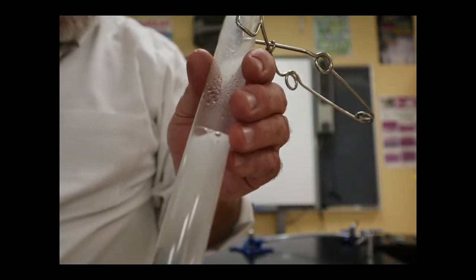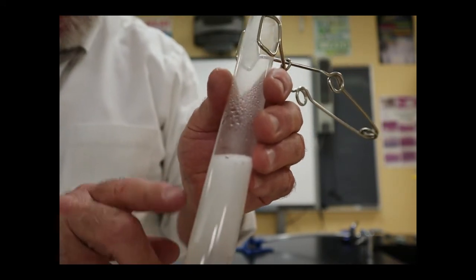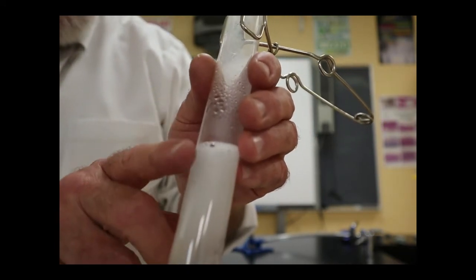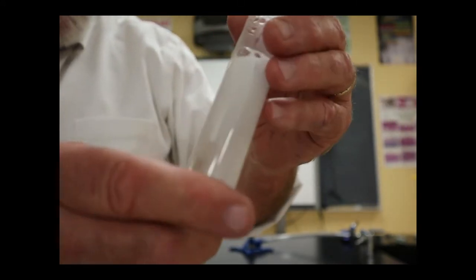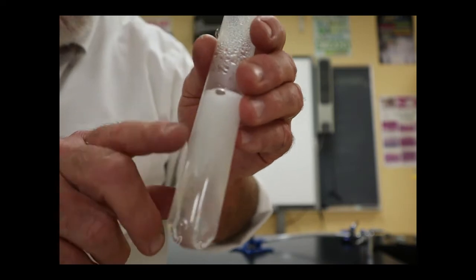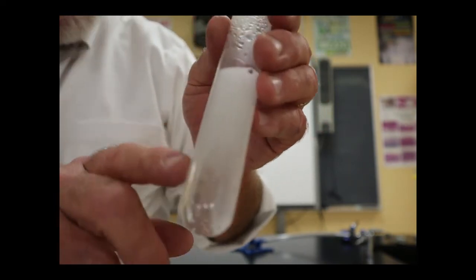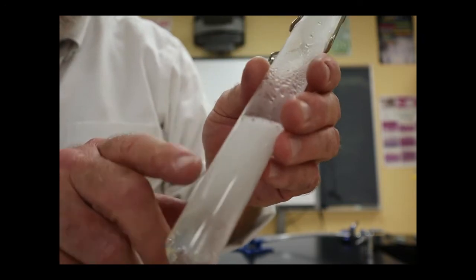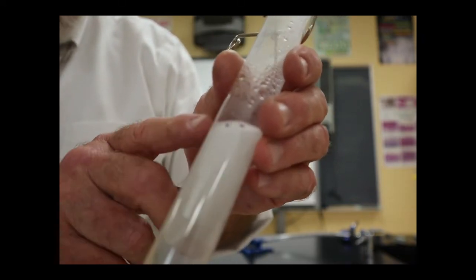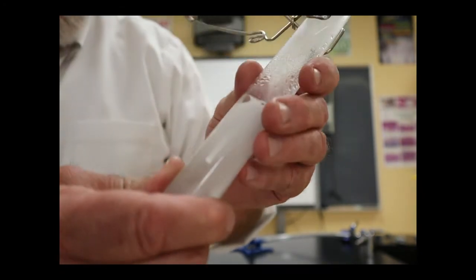In the process, the hydrogen that's in the hydrochloric acid has a hydrogen with a plus 1 charge, and those electrons, an electron gets added to a hydrogen ion, this plus 1 charge, to give you hydrogen, the element. In fact, that's what we're seeing here. It's hydrogen gas coming off. Hydrogen gas. It's actually getting a little bit warm.